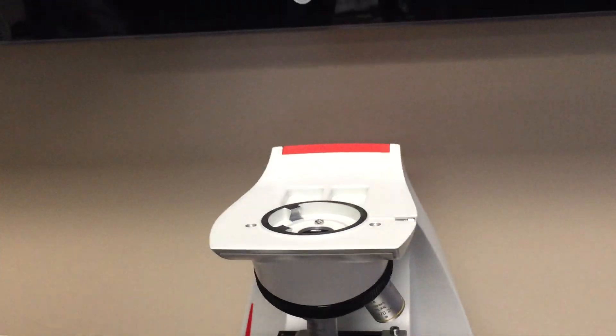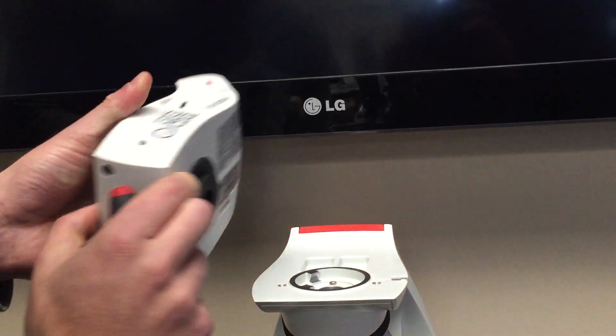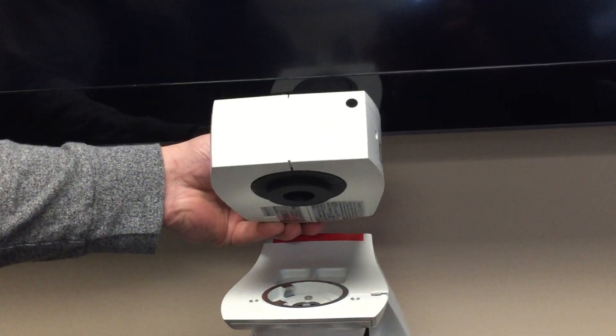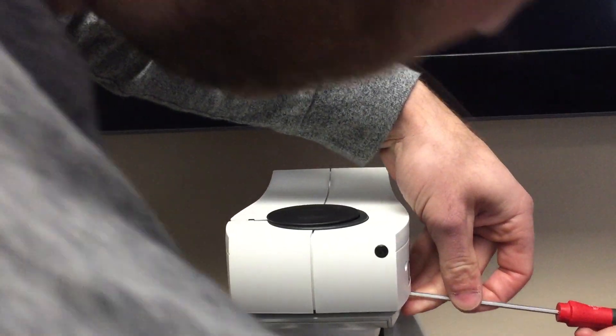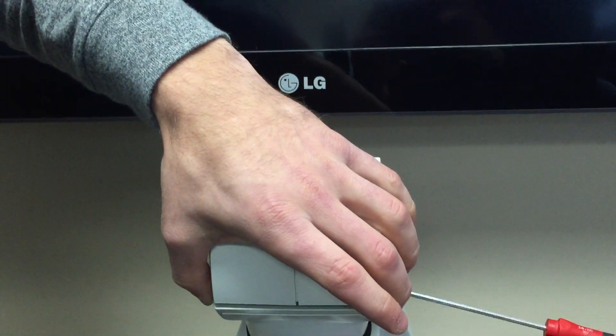Remove the cap from the underside of the camera and place the camera on the flange. Tighten the screw down, ensuring that the camera is centered on the microscope.